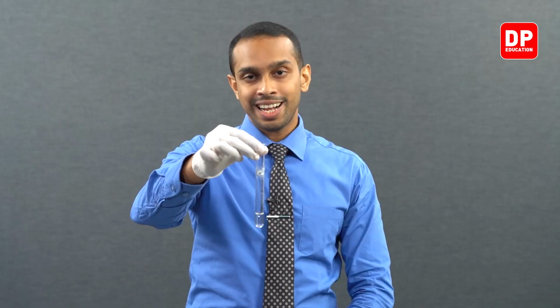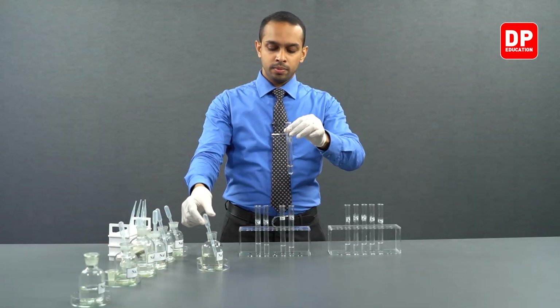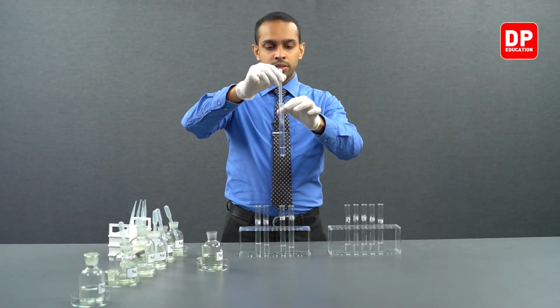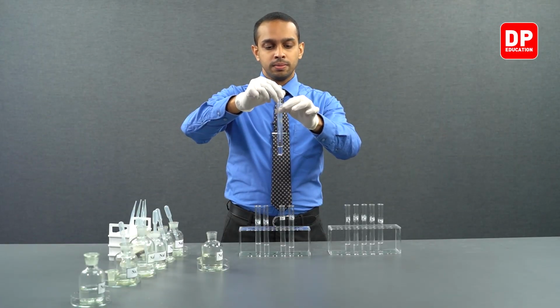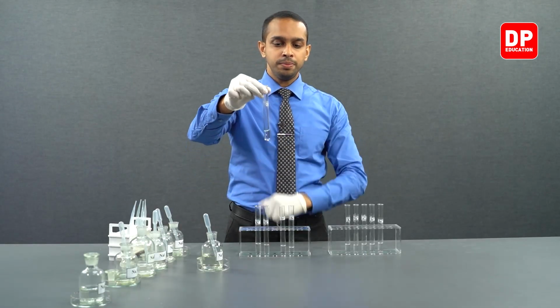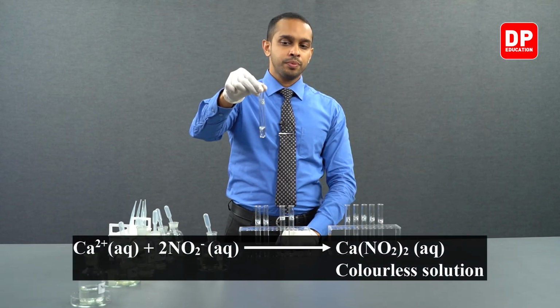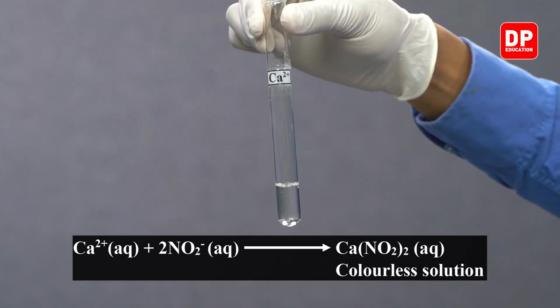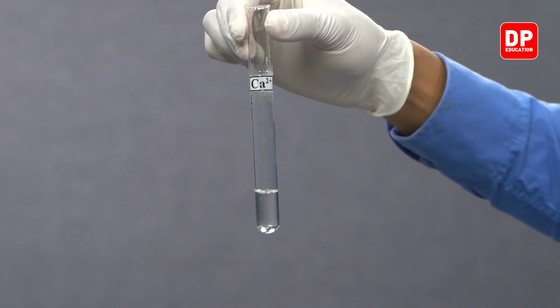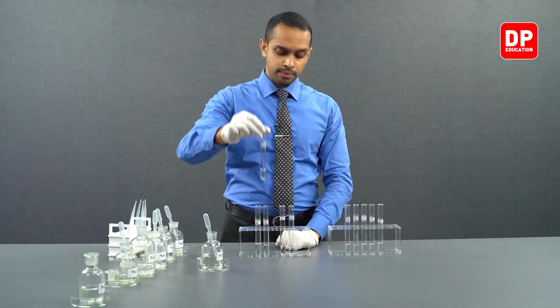We have our calcium 2 plus aqueous ion solution. To that as well, we will add a small amount of nitrite ions by adding sodium nitrite into the mixture. You can see calcium ions, when reacted with nitrite ions, form calcium nitrite, which is soluble in water, so therefore it will also not form a precipitate.